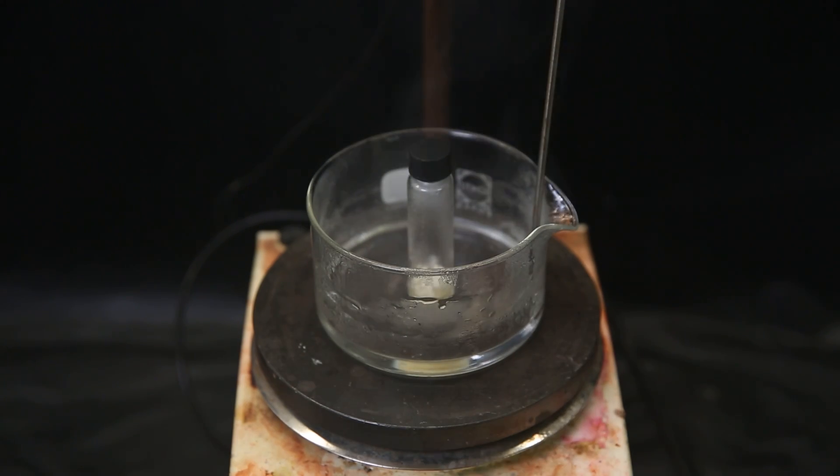I also melted down the rest of the product. And then I forgot the cap was loose and dropped it. Oopsie, bye-bye.